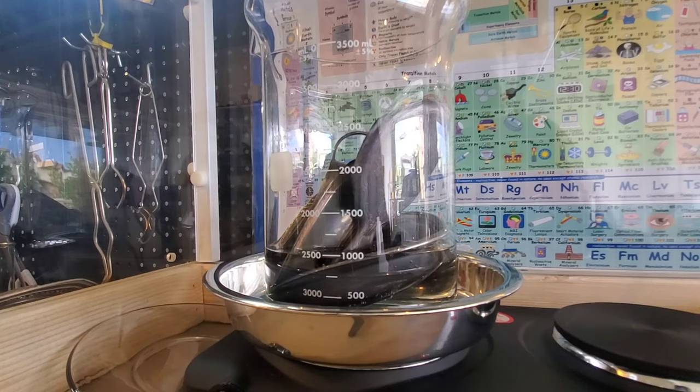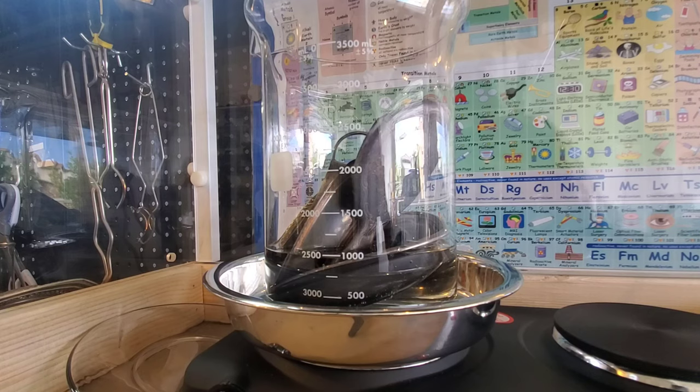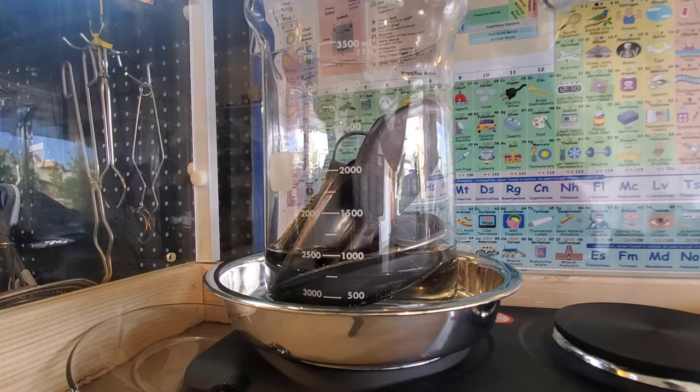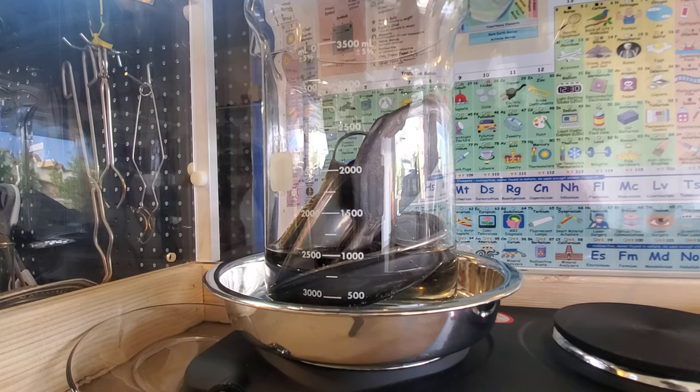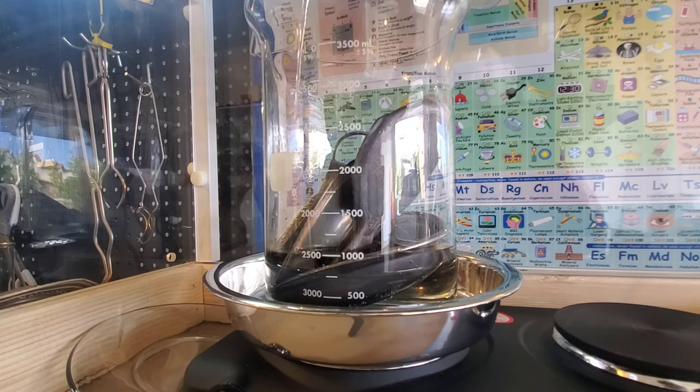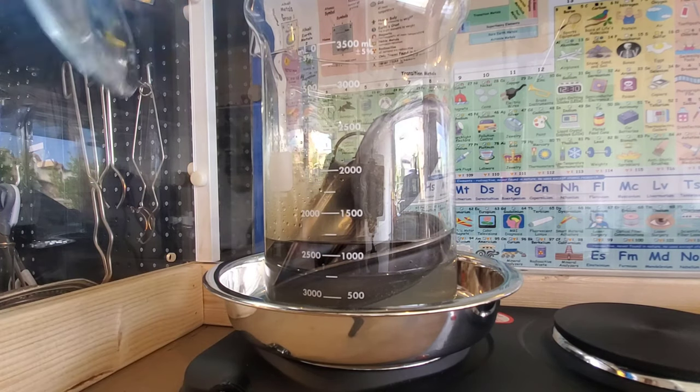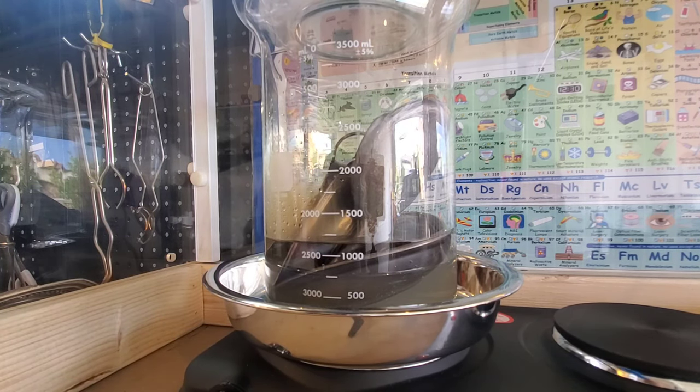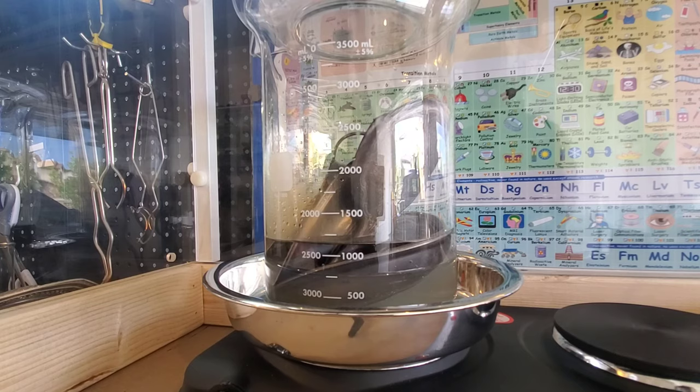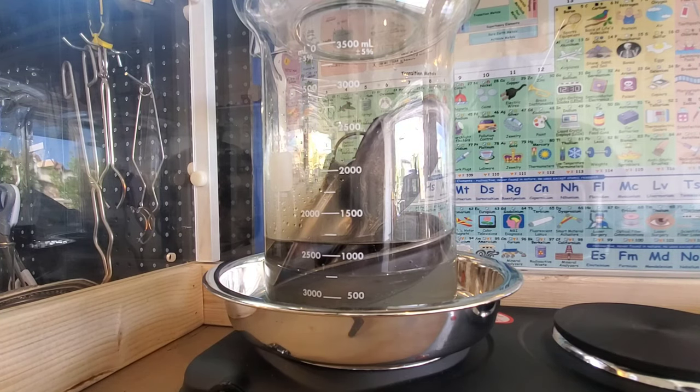All right we've got the fume hood turned on. Now I'm going to slowly add some nitric acid to start our reaction. Cover that up. Let the reaction begin here.